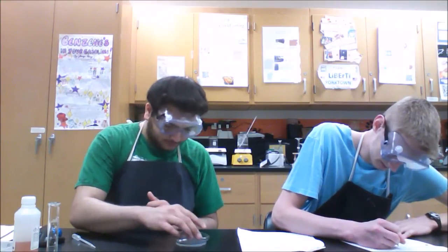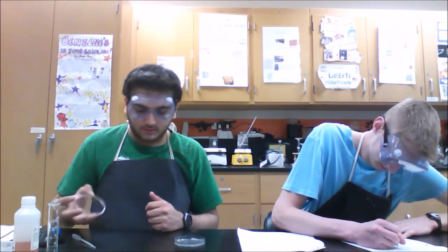It's been 60 seconds, and there's a ring around the crystals. So now you just put the lid back on and swirl, and look, it turned clear. As you can see, the equilibrium shifted in the other direction upon the addition of the crystals. So the solution is now fully clear. Pretty cool.